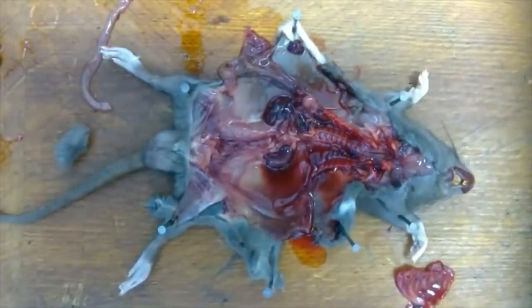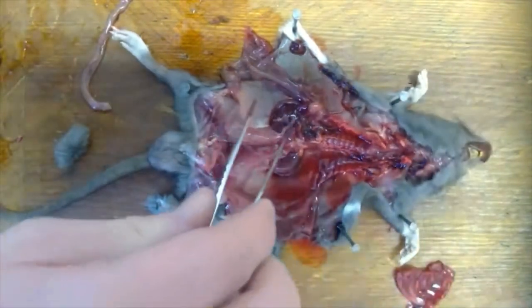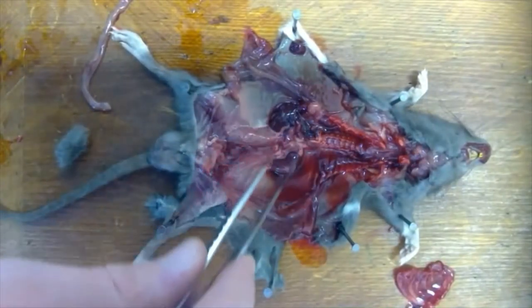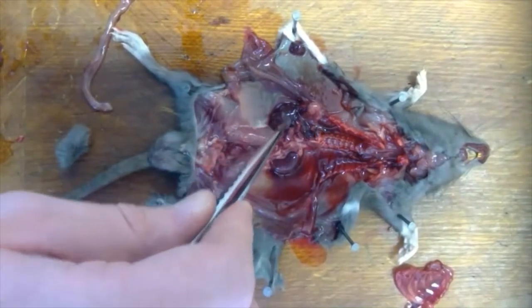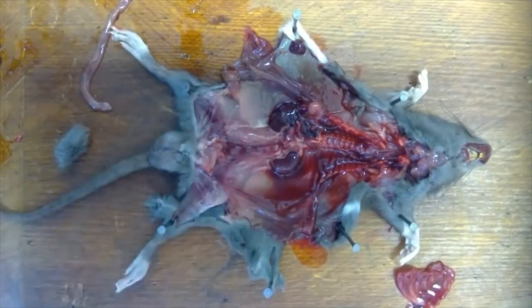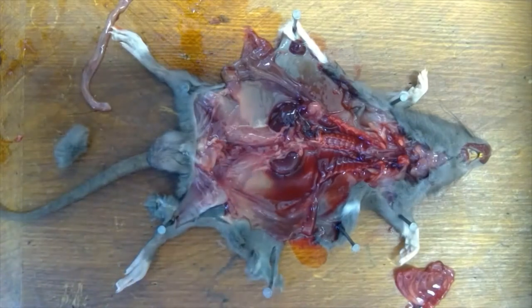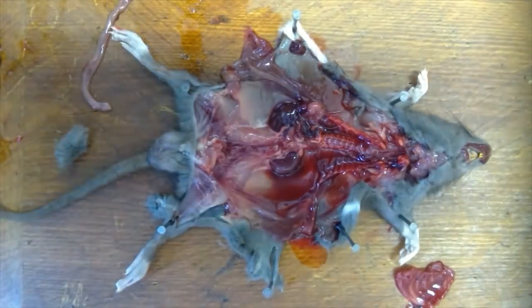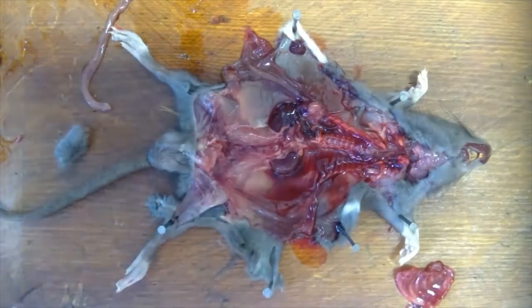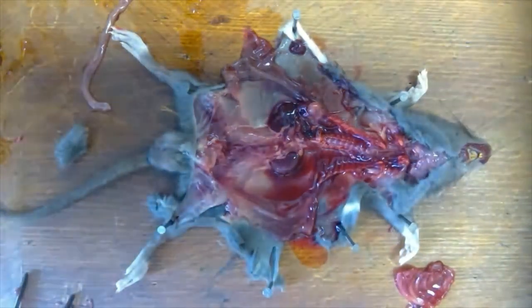The next system I wanted to show you is the urinary excretory system, which is comprised of the kidneys — two kidneys either side of your spine — plus two tubes called the ureters, which carry urine created in the kidneys down to the bladder. The kidneys' role is, in layman's terms, to clean the blood: it filters the blood of toxins produced through your own metabolism. I think if we look at the mannequin first we can see the organisation and it will give you context for the dissection.